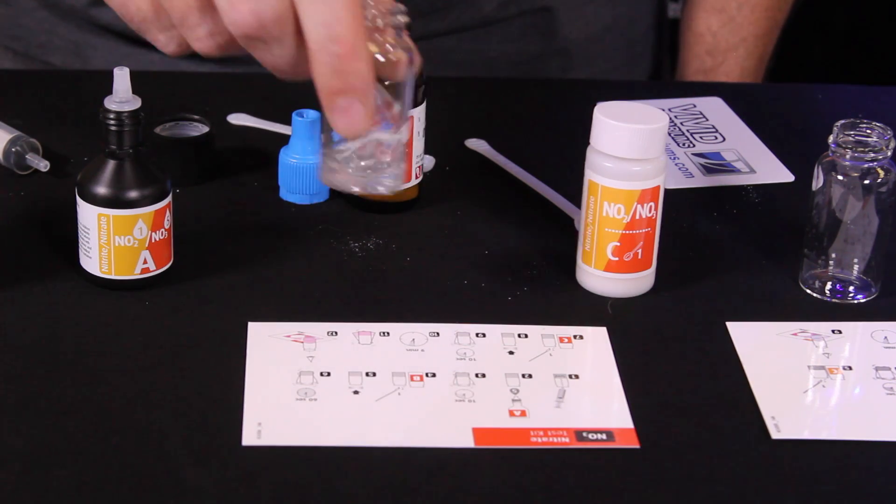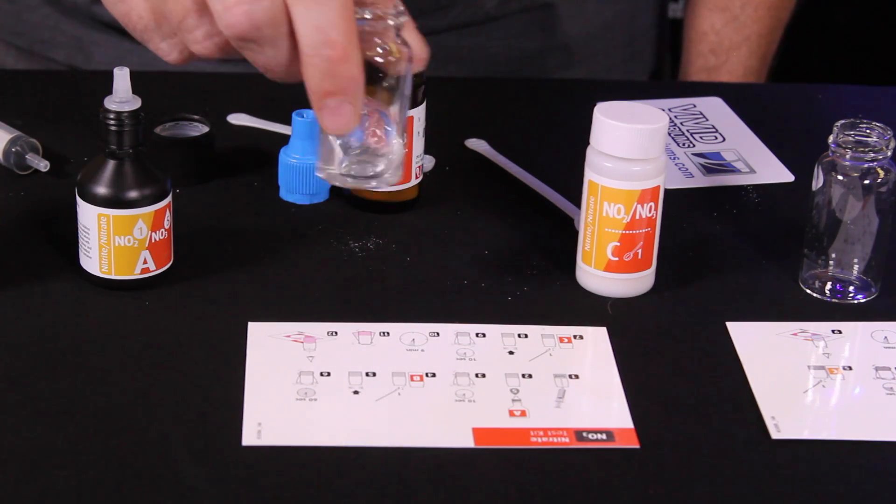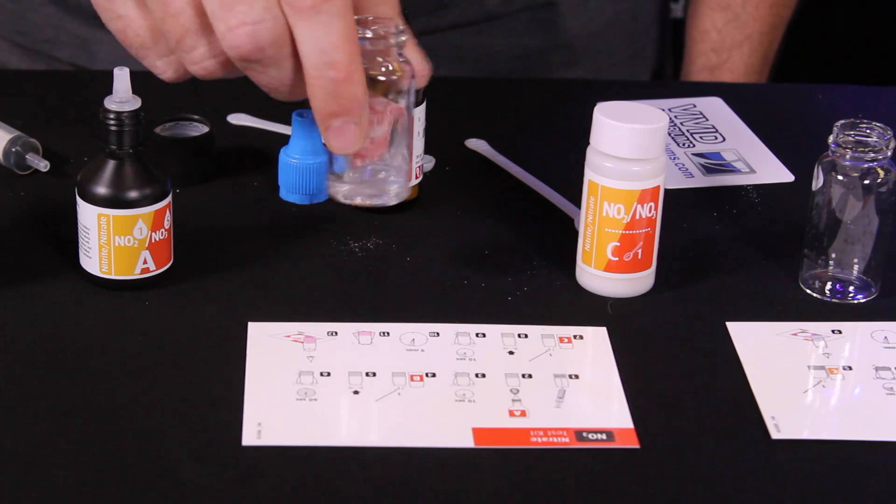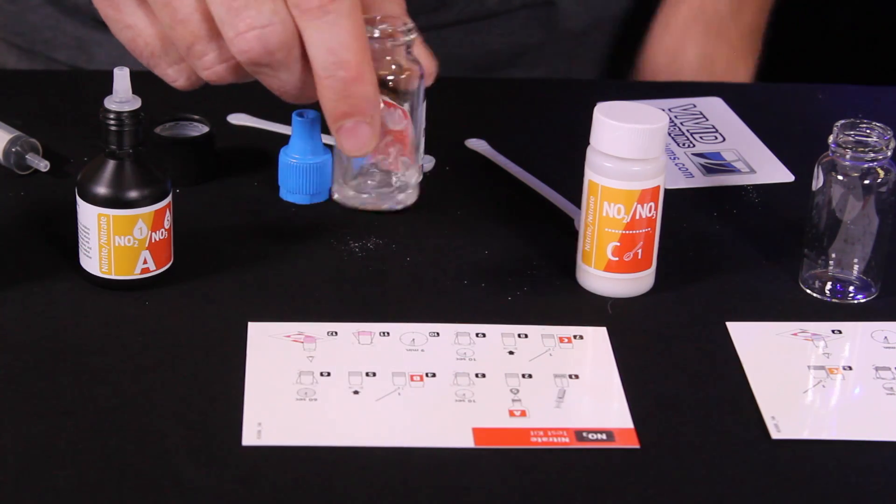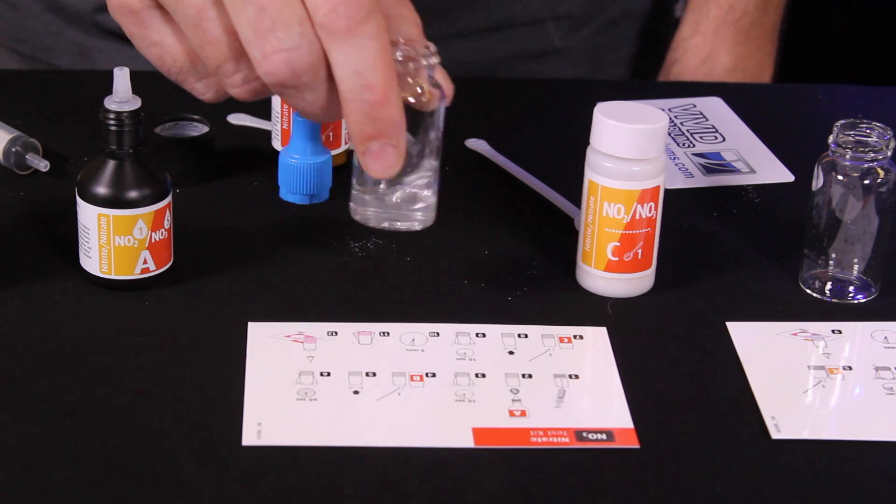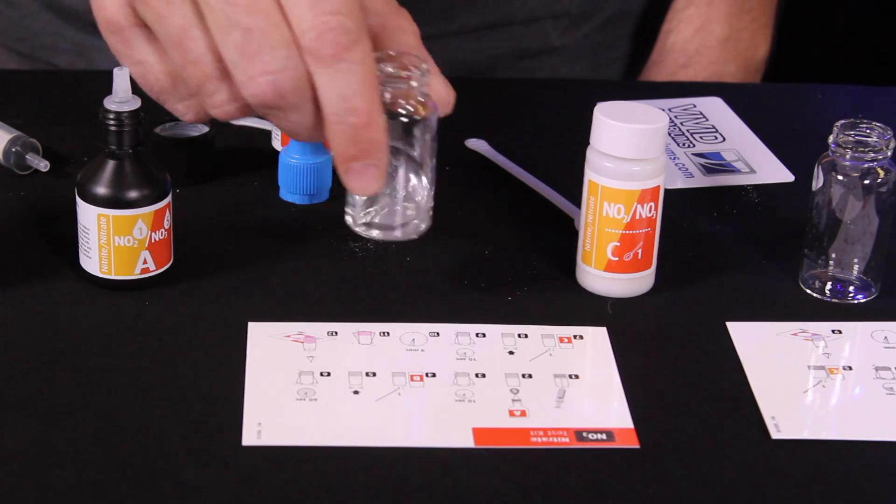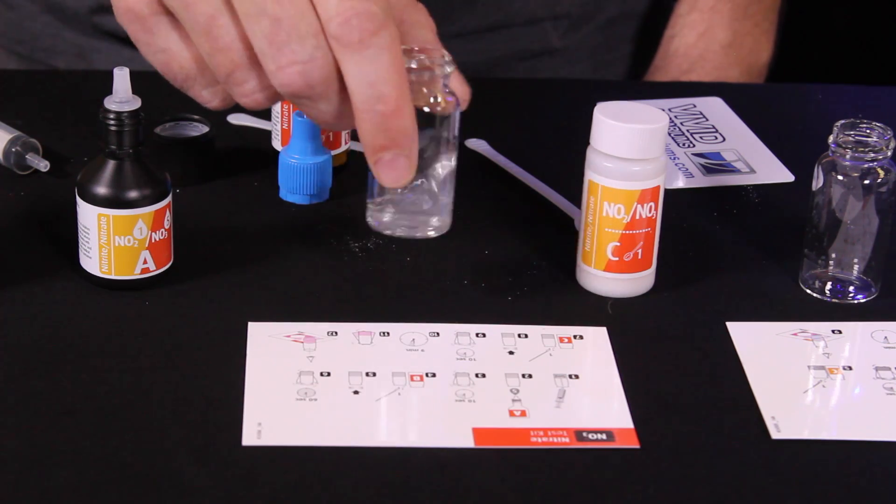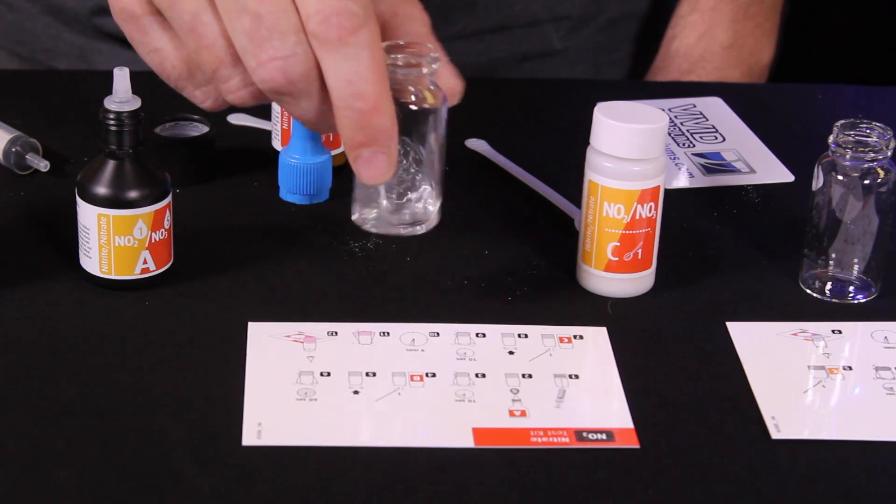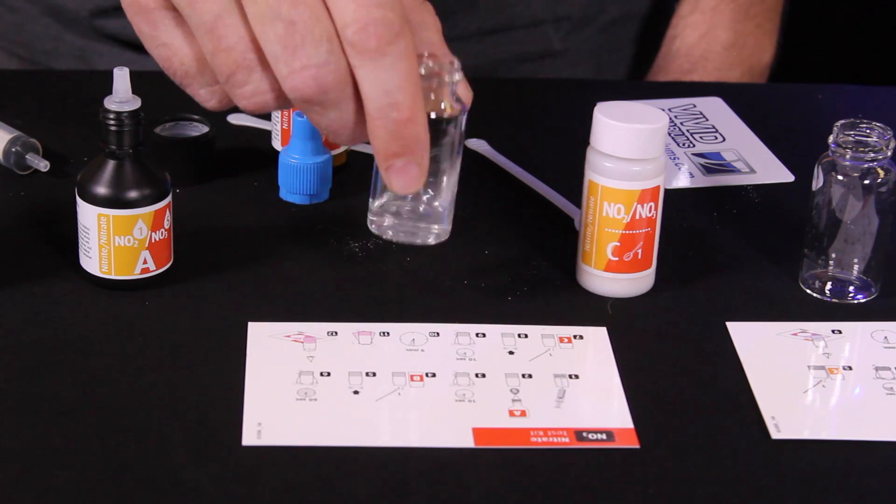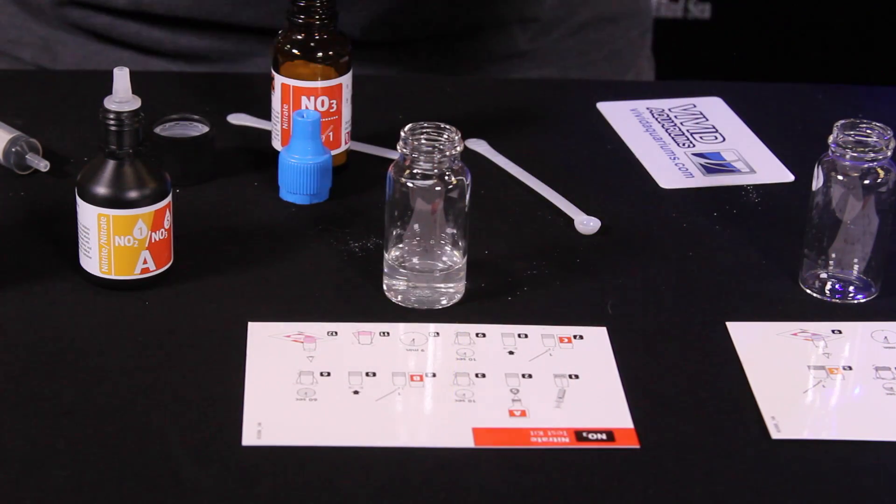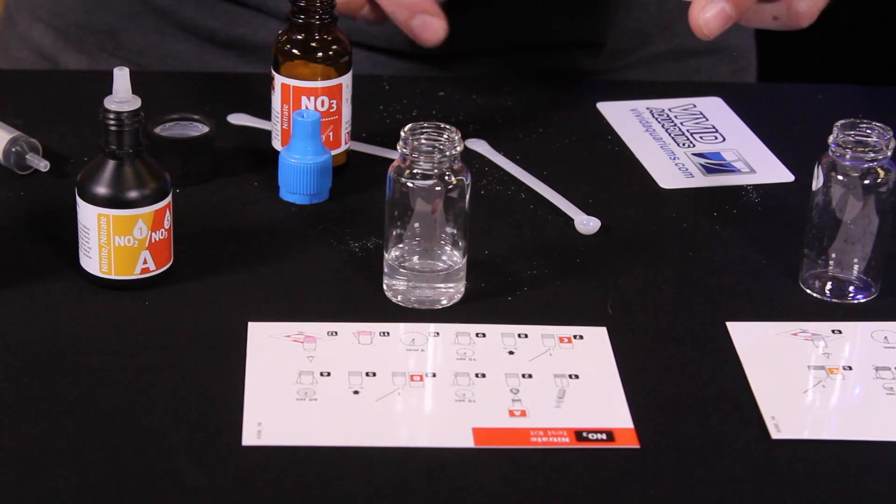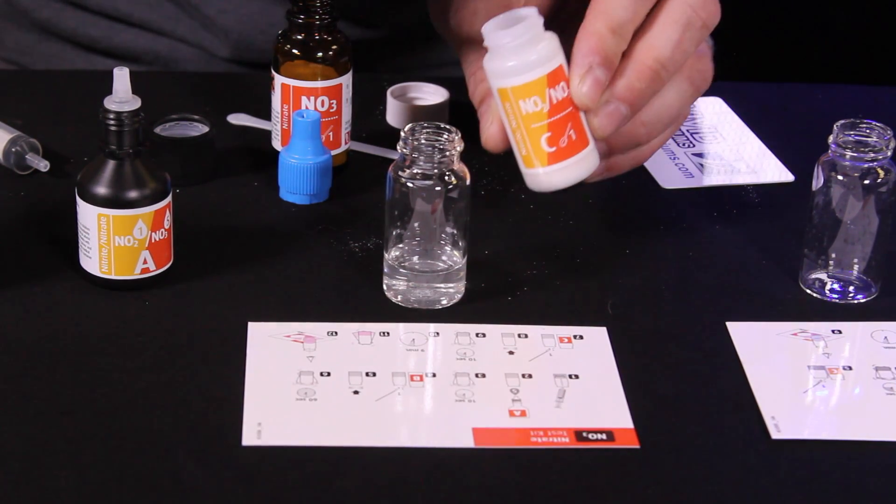And then we're going to go ahead and swirl that for 60 seconds. Sometimes I wish I had a machine to do this, but you do want to make sure that the reagent is evenly mixed and dissolved within your test solution. All right, almost there.